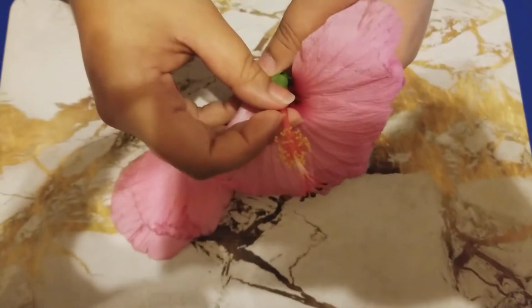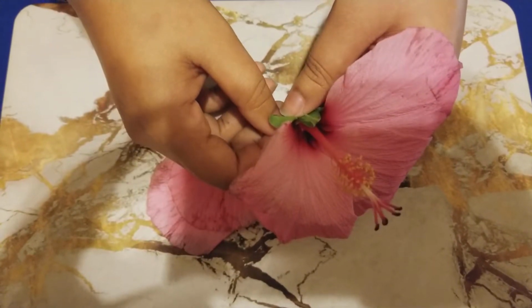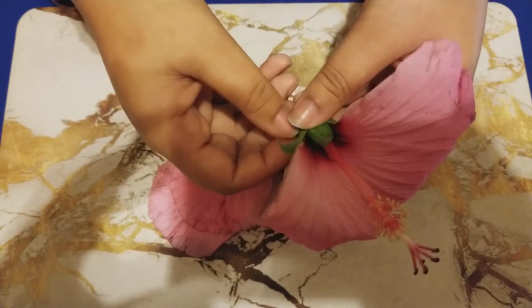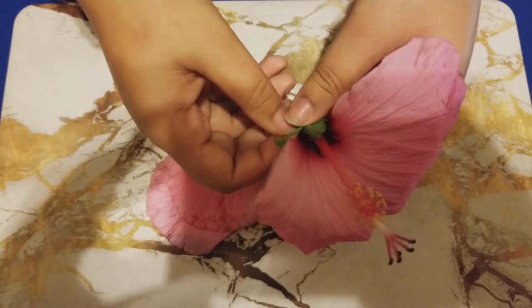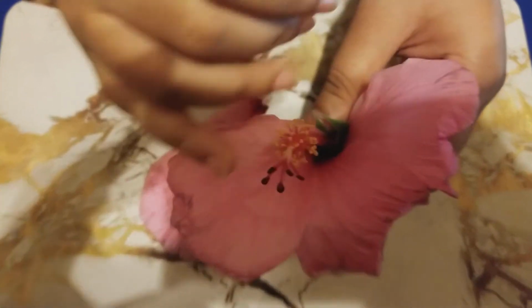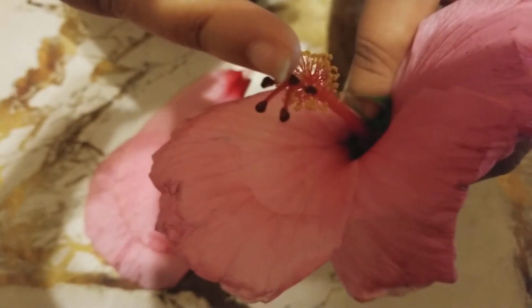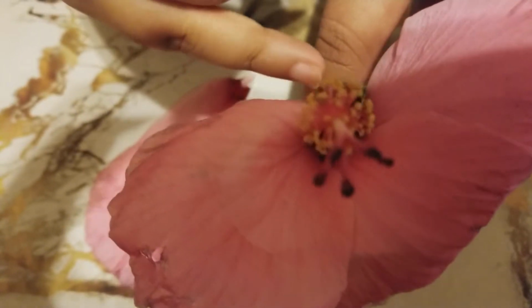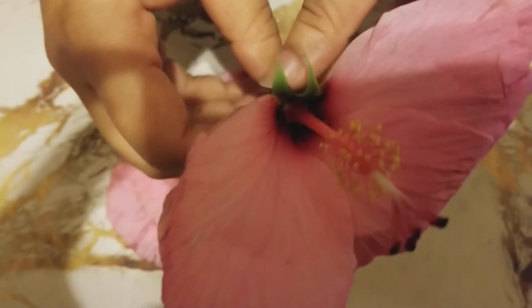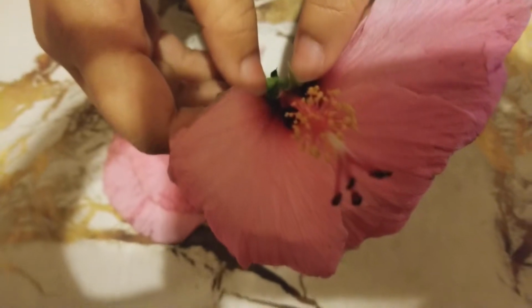Now let's talk about the female reproductive structures of the flower, which are called the carpel. The female reproductive structures of the carpel include three things. Those three things are the stigma, the style, and the ovary. Now, the stigma are these very dark purple parts of the hibiscus flower right on top here. Most stigmas are covered with a waxy, sticky substance, and they play a very significant part in the reproduction.